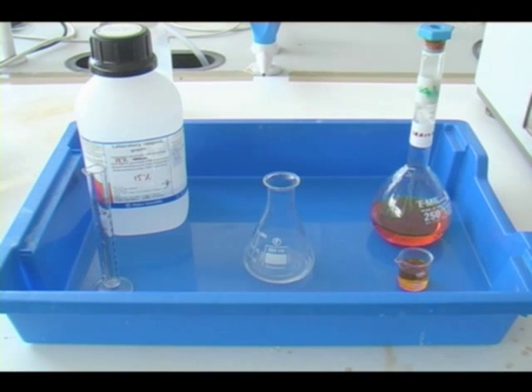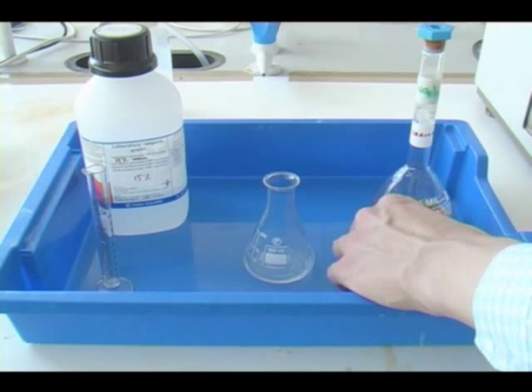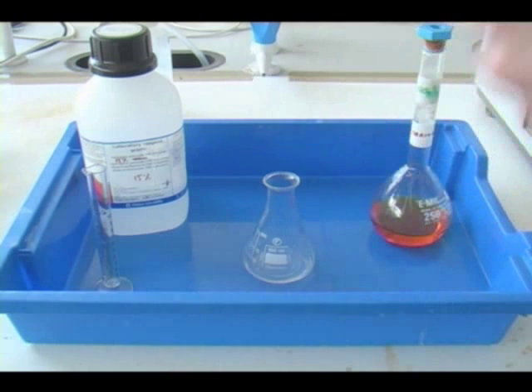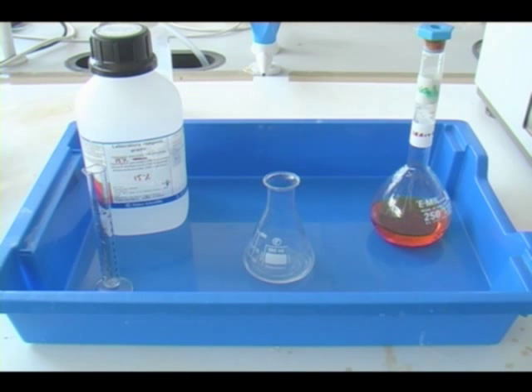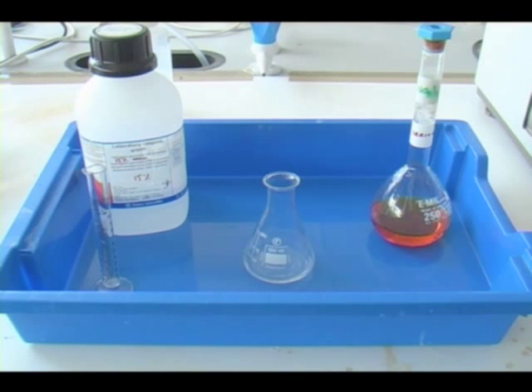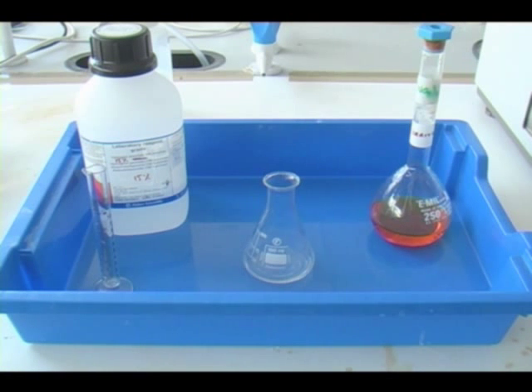So we can add a catalyst to speed up the reaction. The catalyst is a solution of iron nitrate. Here I'm going to add 3 millilitres of this to my hydrogen peroxide.